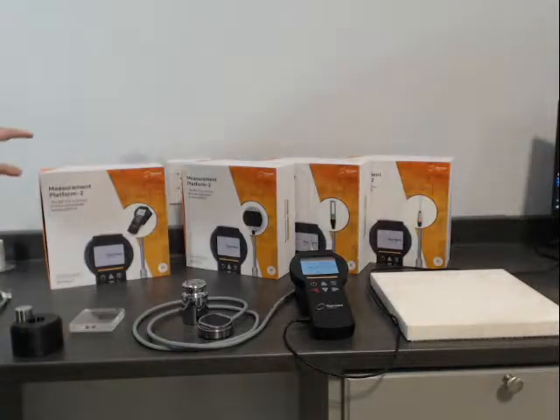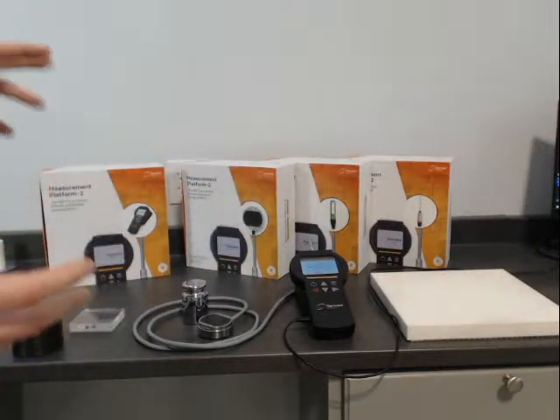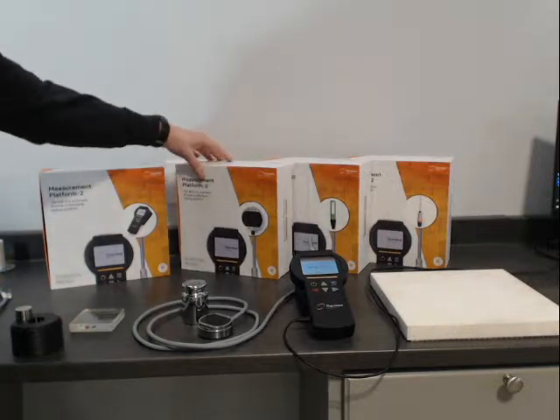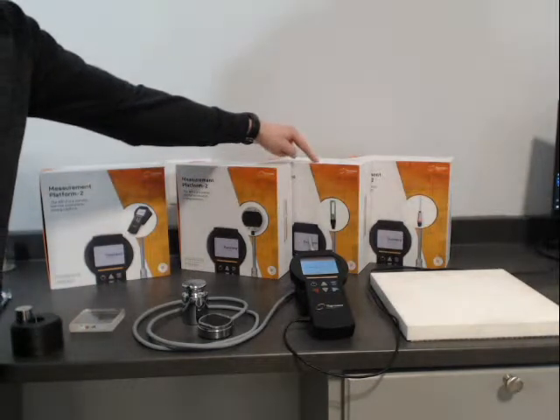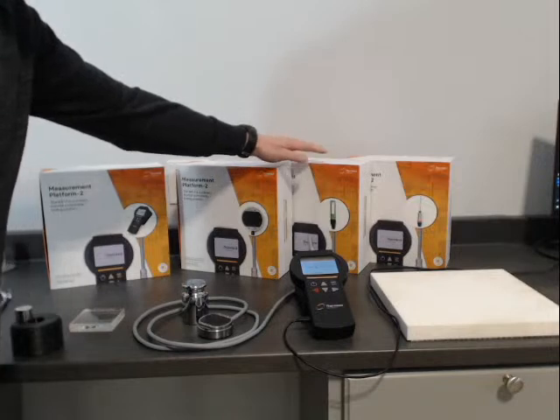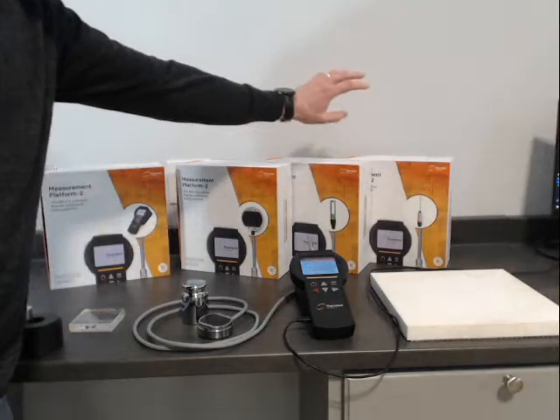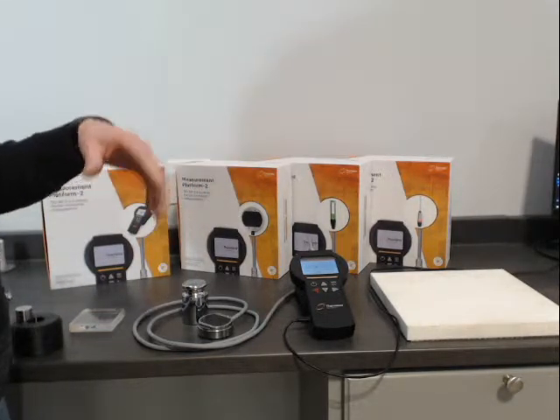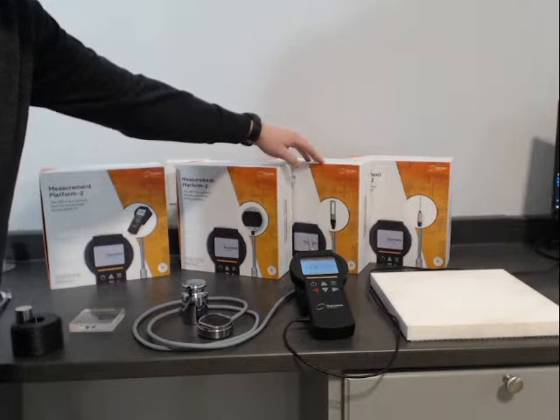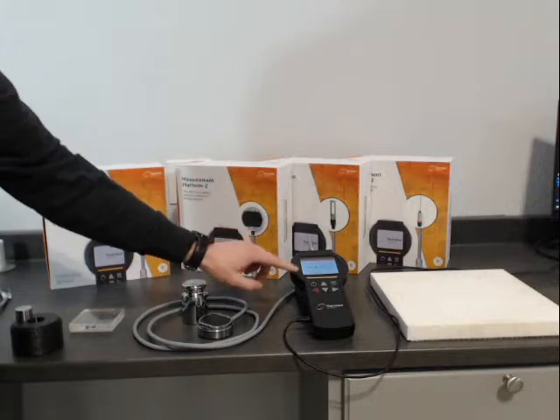Each unit comes with a convenient box that lets you keep either the controller or the sensors safely packed away and tucked so that they last a long time. The three sensors we're going to talk about today are: asymmetric or single-sided transient plane source; transient hotwire for measuring liquids; and transient plane source for measuring solids and powders. Also, transient line source — for measuring soil and some additional types for measuring rocks — following ASTM D5334 and ASTM D7896, a modified version because it does not have a Wheatstone bridge.